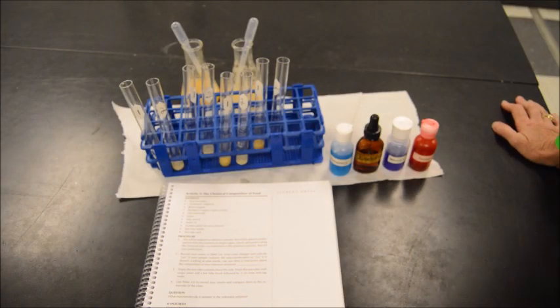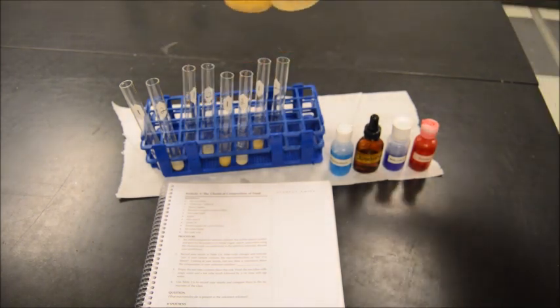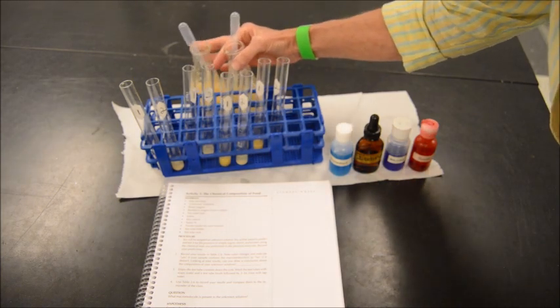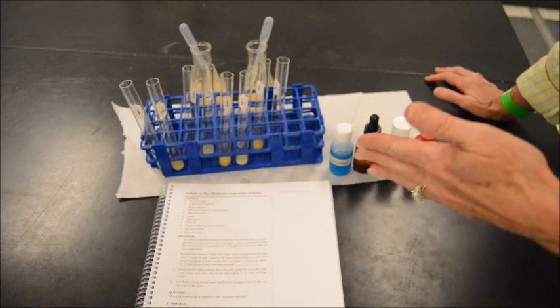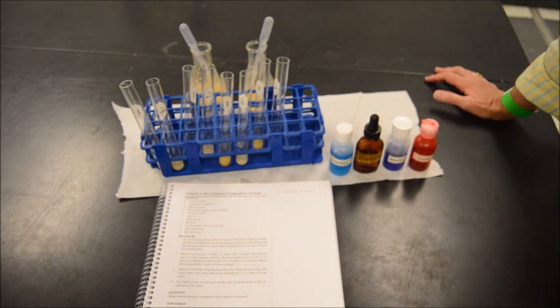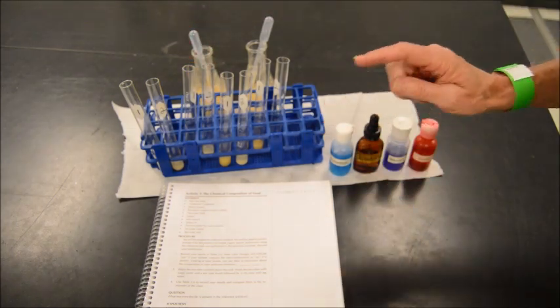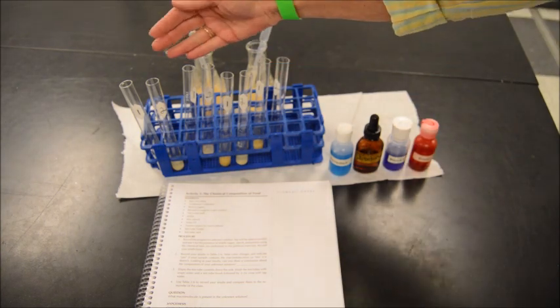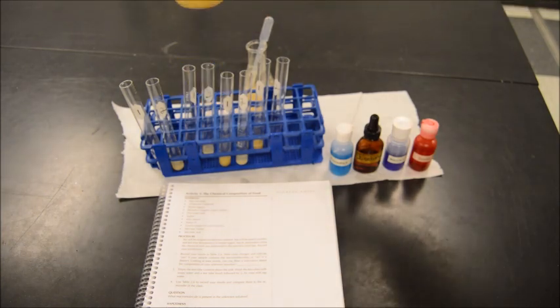Okay, so the last activity in Lab 2 is to check out 2 unknown solutions. We just have some food substance here. We have no idea what this is. And to see what chemicals are in it, and if we can predict by virtue of the positive test versus the negative test what that food item might be. So even though y'all don't know what it is, we do have some kind of idea since we had to make up the solutions. So we have taken 4 test tubes for unknown number 1.